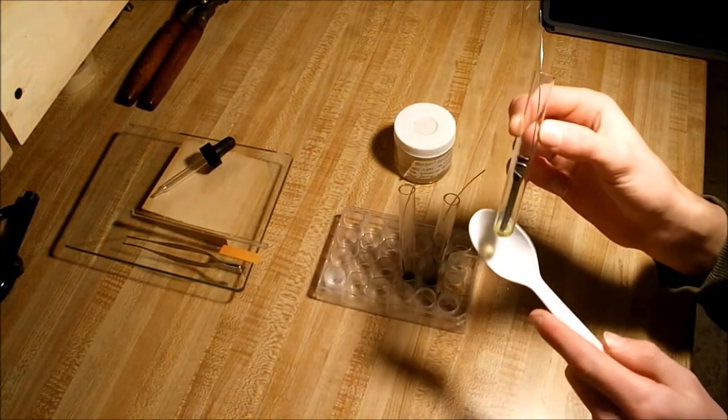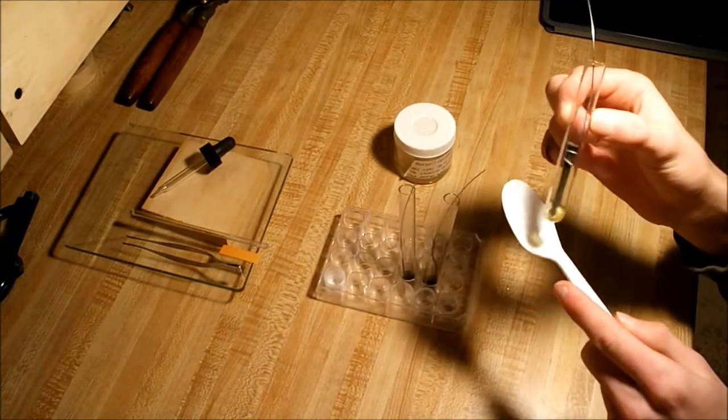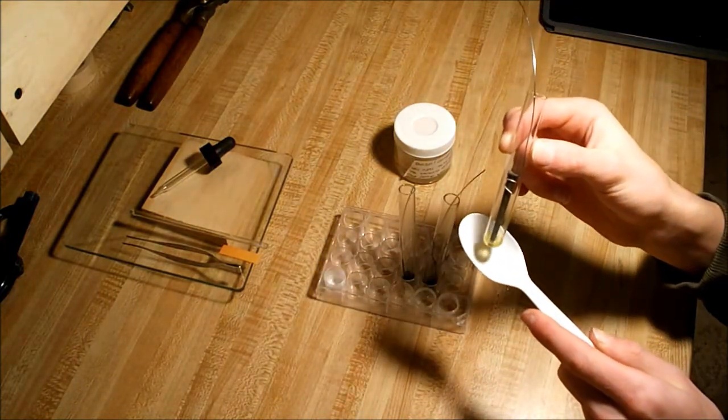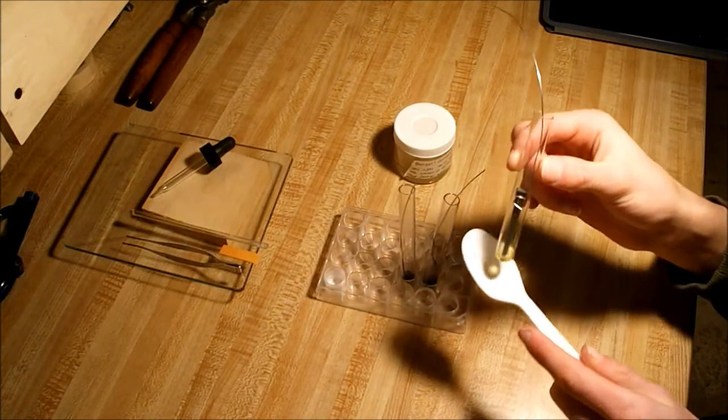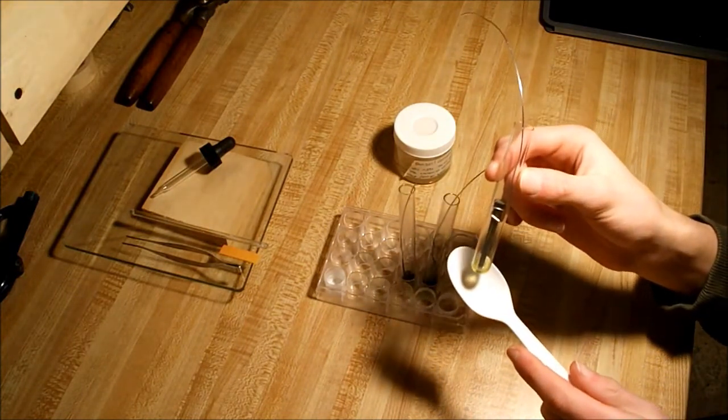The yellow comes from iron three plus, which is a slightly less common iron ion. They're both pretty common, but for the most part this is iron two chloride.